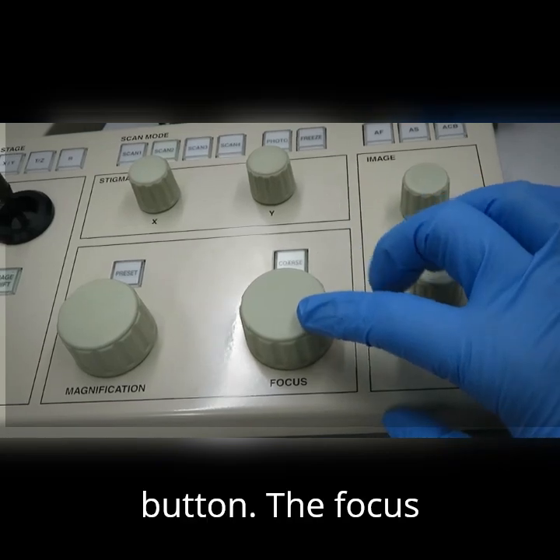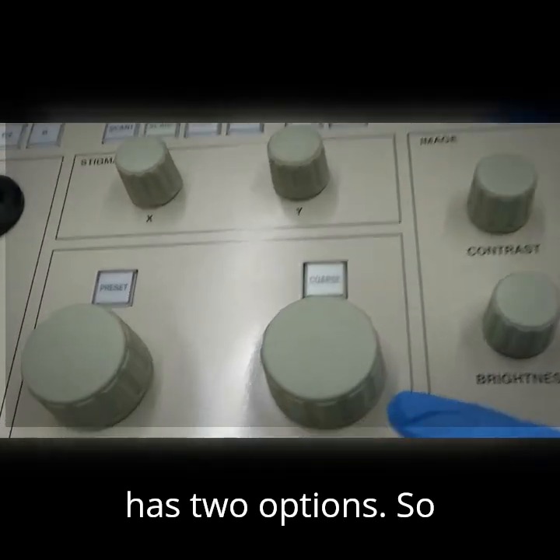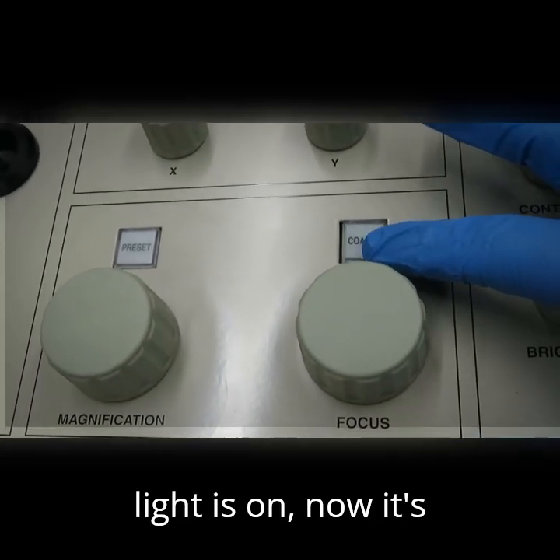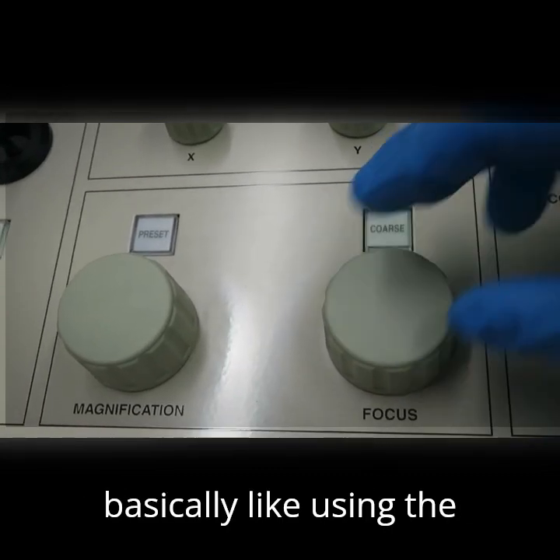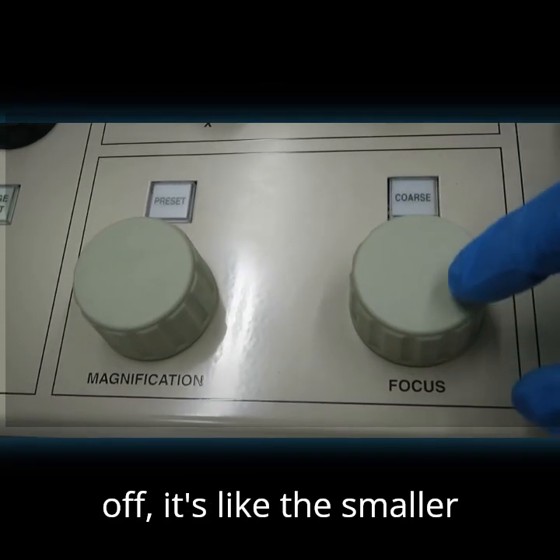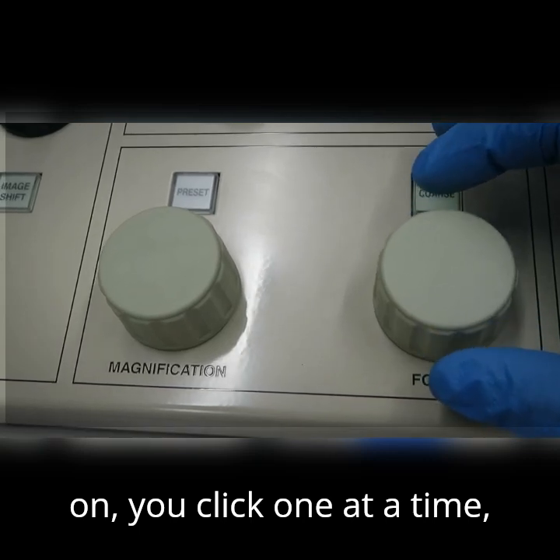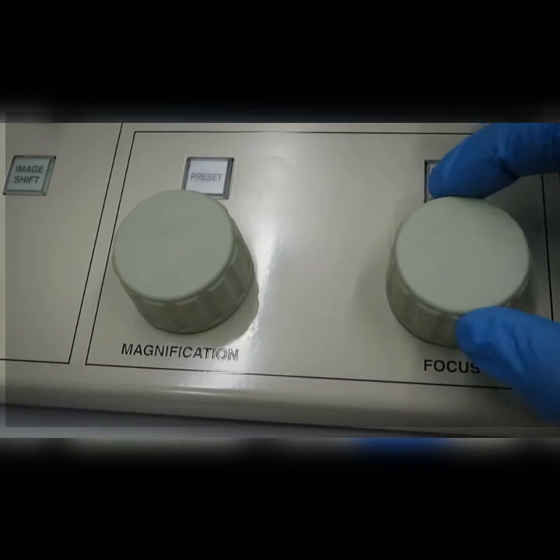And this is your focus button. The focus has two options. You'll see that there's a coarse button, and when the light is on, it's basically like using the bigger knob of a microscope, and when it's off, it's like the smaller one. When it's on, you click one at a time. When it's off, you can scroll a little bit more.